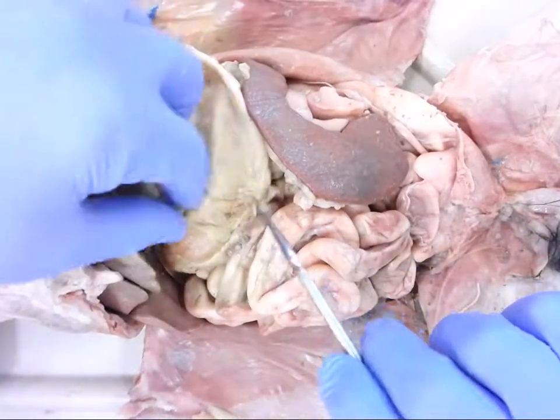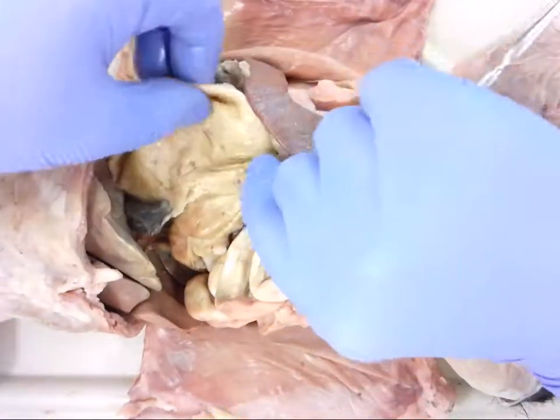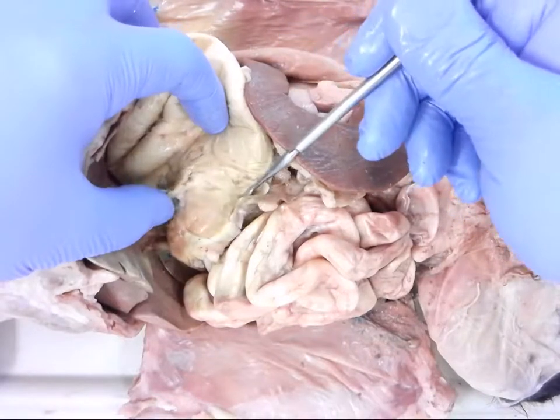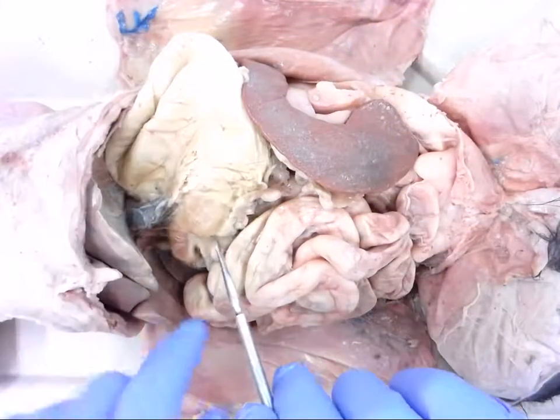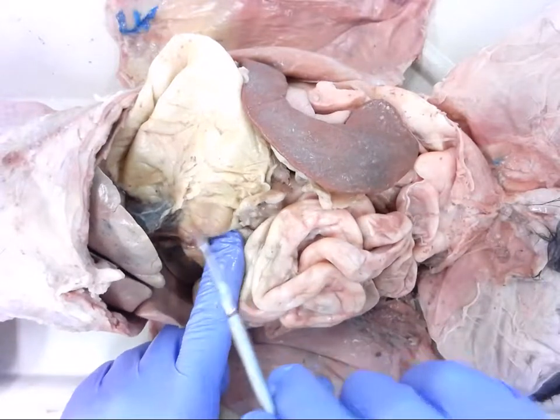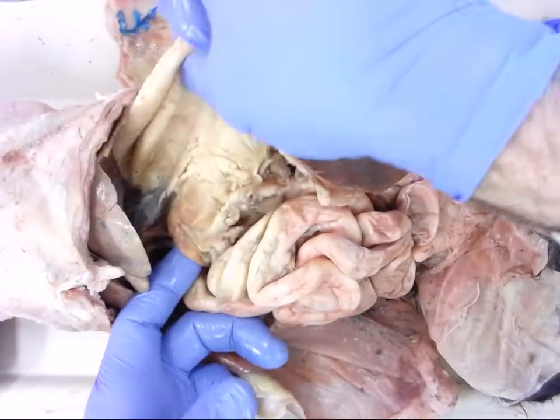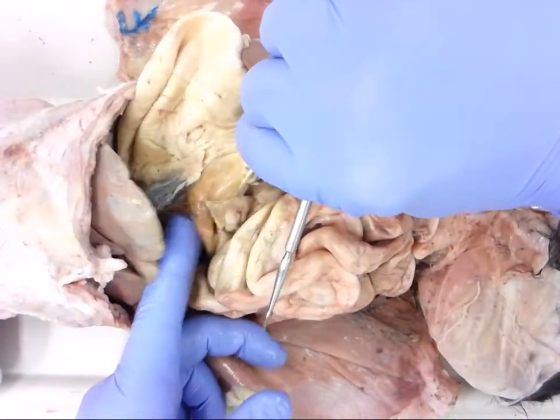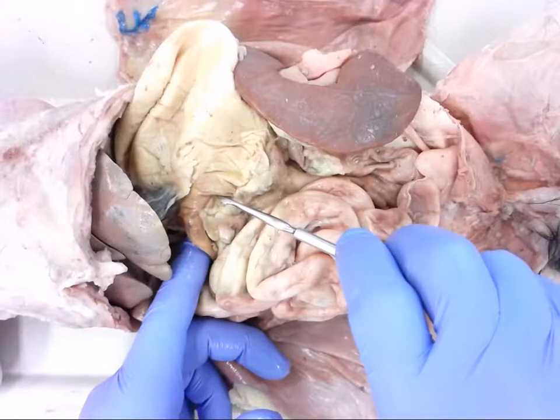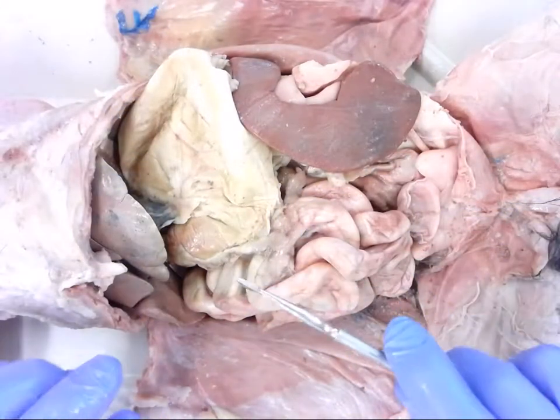As we continue down toward the bottom of the stomach it starts to narrow — this is called the pyloric region. As it narrows, at the very end of the stomach there's a sphincter muscle called the pyloric sphincter. You can see it narrows slightly and there's usually some fat accumulation there. That sphincter closes to keep the contents of the stomach there for digestion until they're ready to move on.